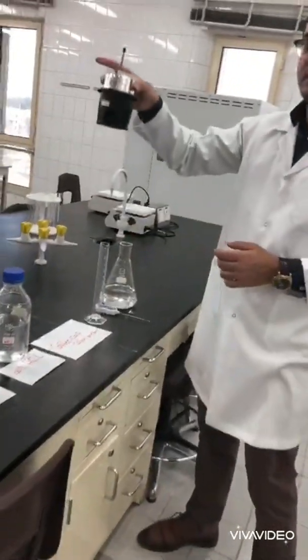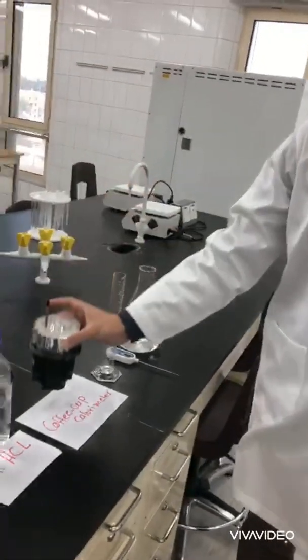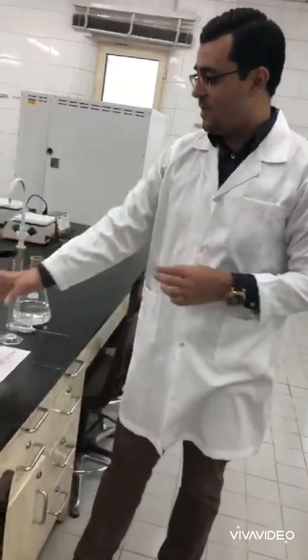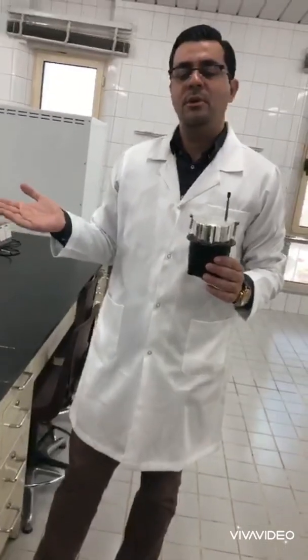This is the coffee cup calorimeter, and this is the calorimeter that we are going to use today. We can measure by using the coffee cup calorimeter any type of heat we want — the heat of any reaction or most of the reactions. Today, we selected a neutralization reaction.